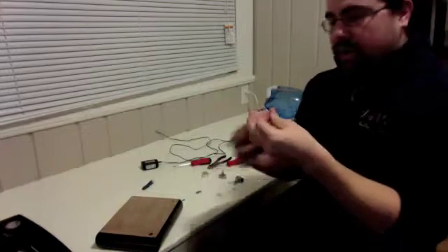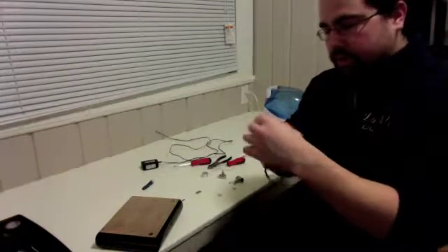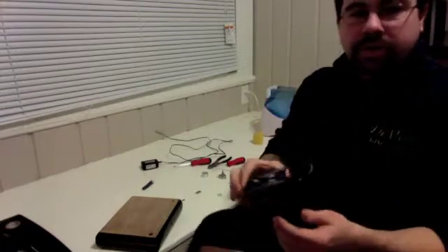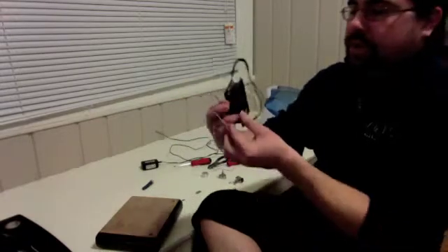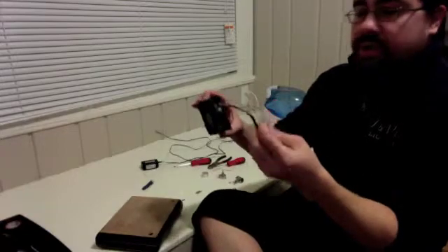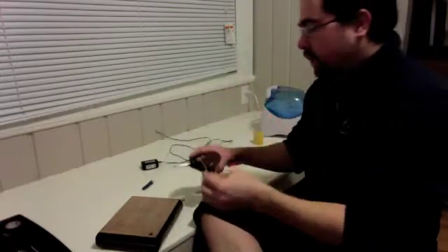Now for your fan, you're going to end up having 3 wires. They will probably come in various color combinations, but the middle one is usually going to be your ground. And that's pretty much the only one you need to make sure you know. So the black one in this case is my ground. Just keep that in mind. We'll deal with that later.